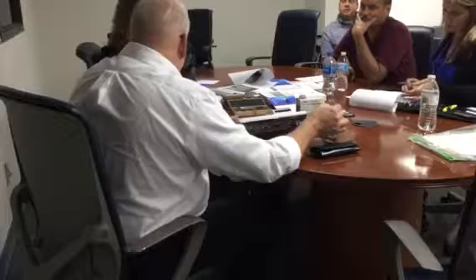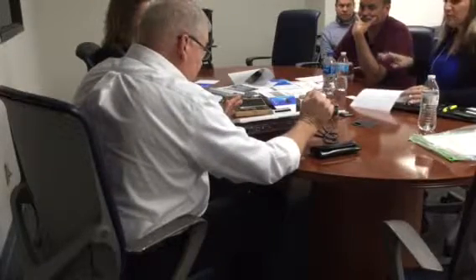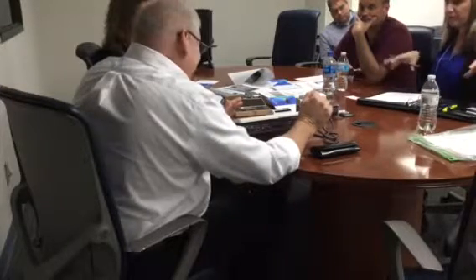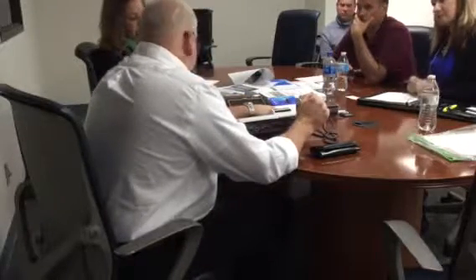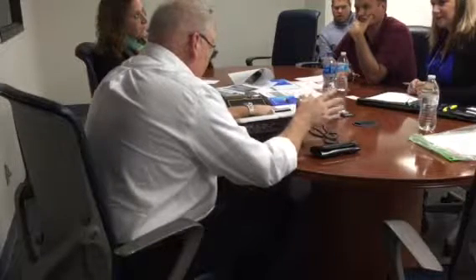Any questions on that? Again, that's the most important thing I can teach you. No issues with the level of the table? You see this little wheel here on the back? That's your leveling. If you wanted to level to your surface, you could. But we don't know how to use that.